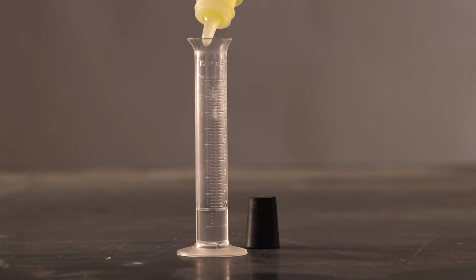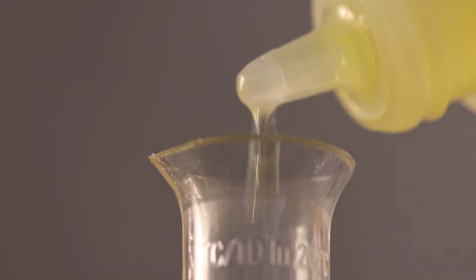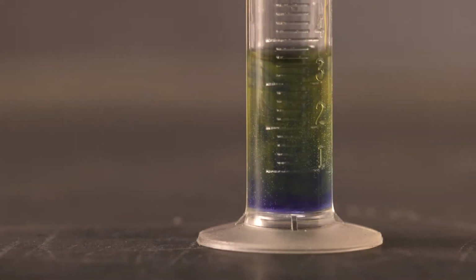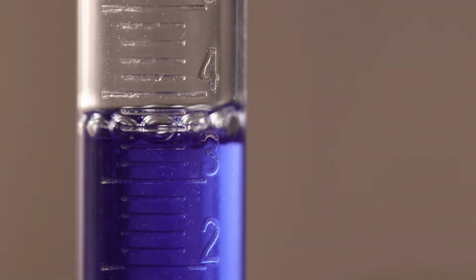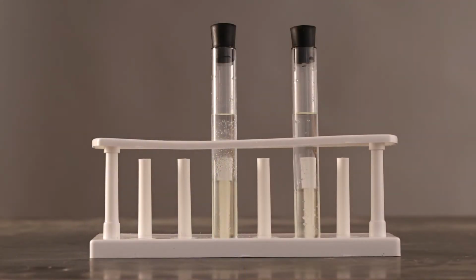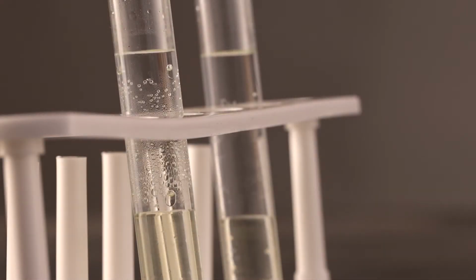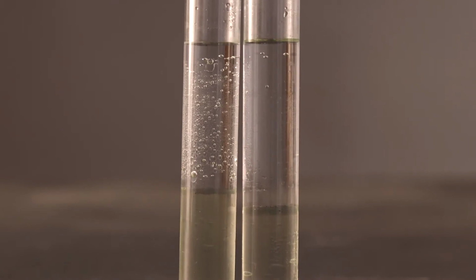Now we will perform a test to show the effect of water on the acid acceptance test. We tested a blank with the acid acceptance solution and came up with a 50 for B value on your acid acceptance test. We are going to test 2 samples, both using 10 milliliters of stabilized solvent and 10 milliliters of distilled water, and let it sit 60 minutes.